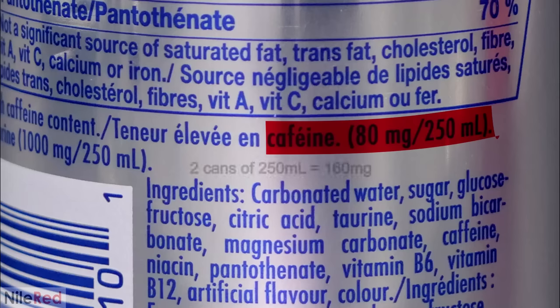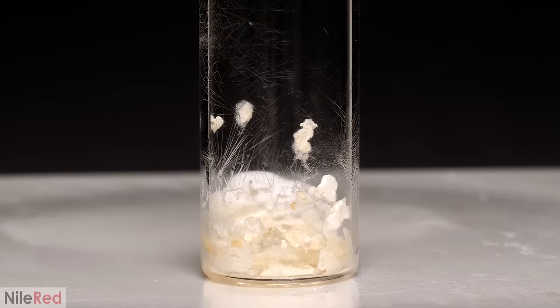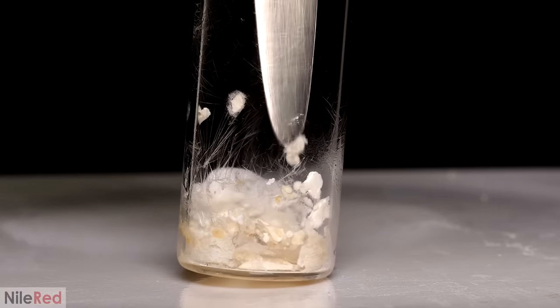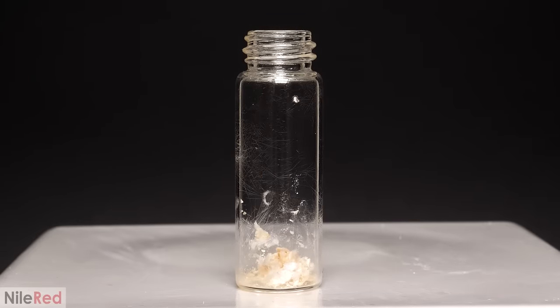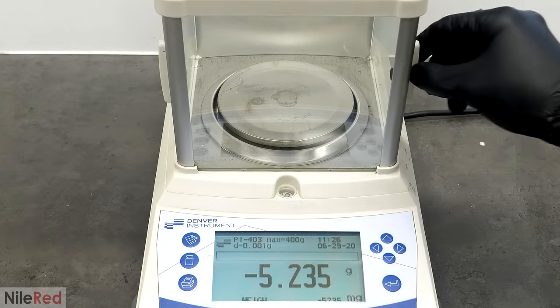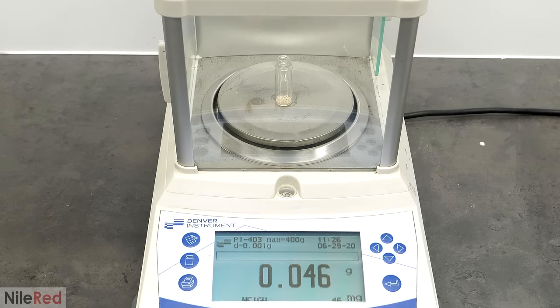There was eventually almost nothing left, and I started to get worried that maybe I had barely extracted anything. However, at the very end, a small amount of solid stuff thankfully appeared. This was hopefully just caffeine, and the amount seemed to be about right. In the original Red Bull syrup, there was only supposed to be 160mg of caffeine, and just visually, that kind of looked like what I had. It did smell though, just like Red Bull, which meant that I had definitely pulled out some of the other stuff as well. I then mixed it up, and I let it sit there for a bit, just to make sure that all the DCM was gone. After that, I went and weighed it, to see how much I actually had. I was really hoping that it would just magically tell me that it was exactly 160mg, but that of course wasn't what happened.